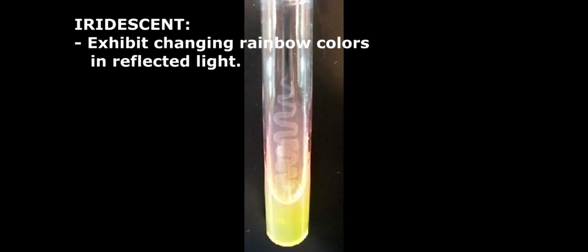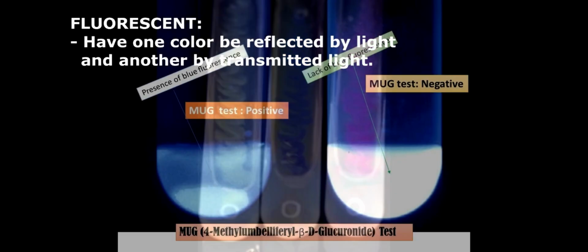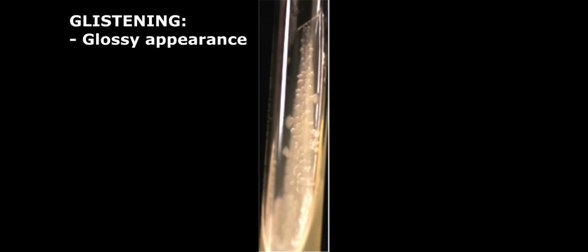For opalescent, the result would have an opal-like color. In iridescent, it will exhibit changing rainbow colors in reflected light. Fluorescent will have one color reflected by light and another by transmitted light. This is used in the analysis of E. coli bacteria because the luminescent signals from metabolites will be an indicator of the vitality of the bacteria. Then there is dull, which does not have any gloss, and glistening, which has a glossy-like appearance.